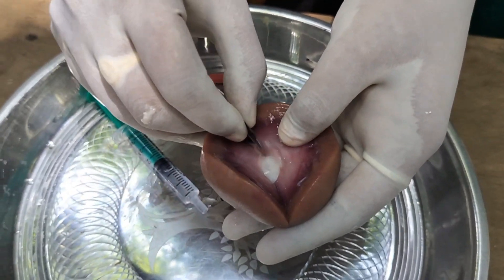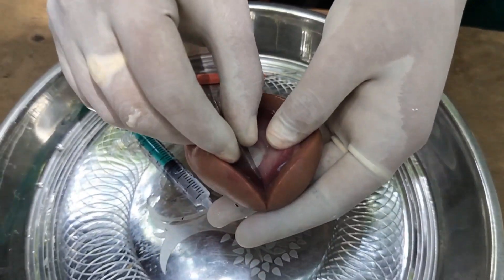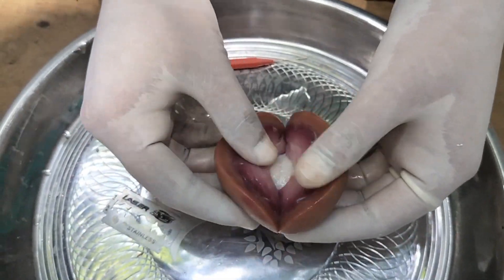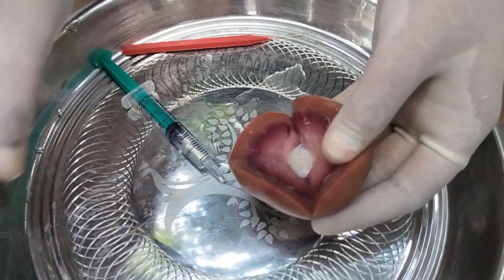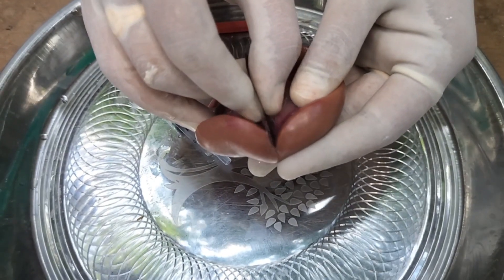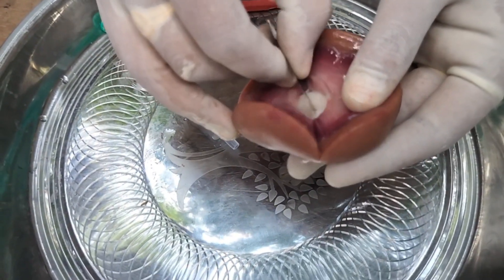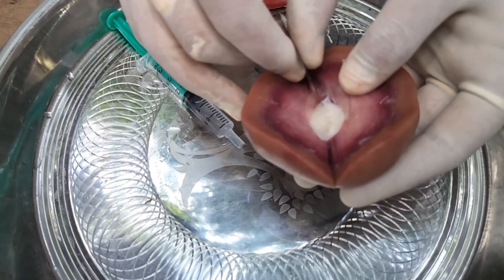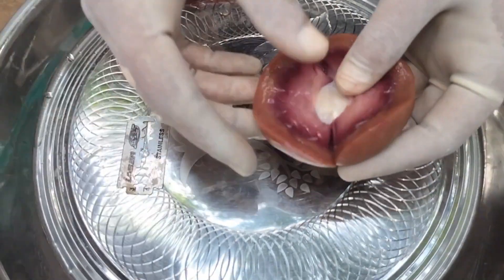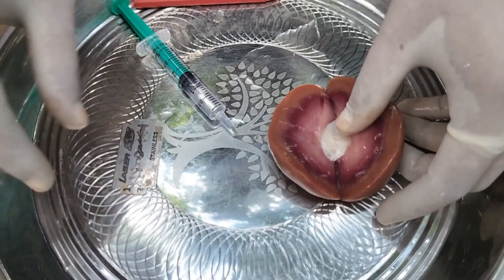Let us observe the internal parts of the mammalian kidney. First, we have to dissect the kidney longitudinally like this. Kidneys are the excretory organs in mammals. Kidneys separate the waste — both organic and inorganic — from blood.